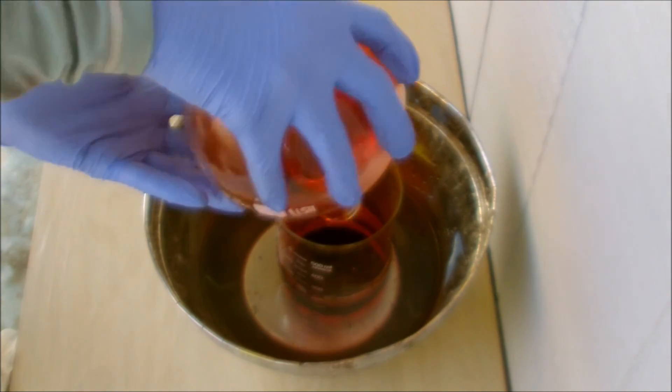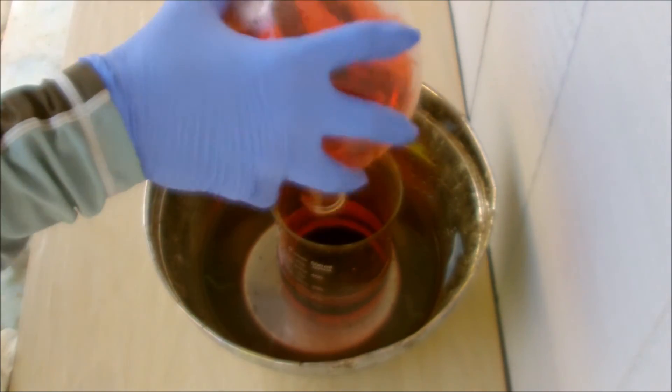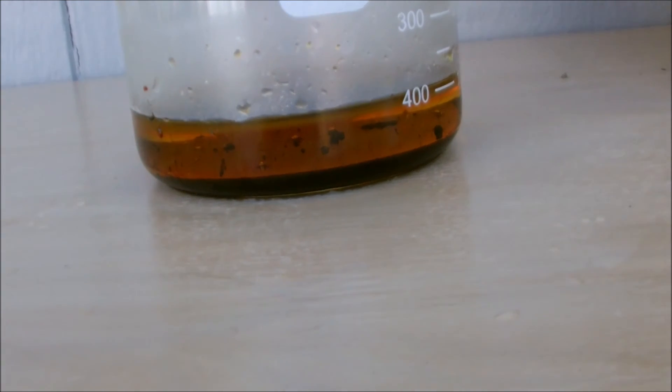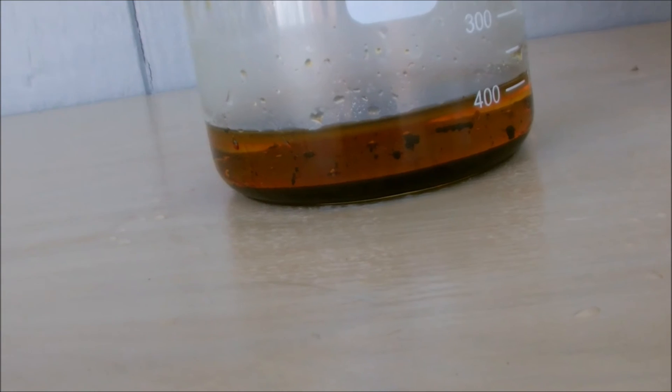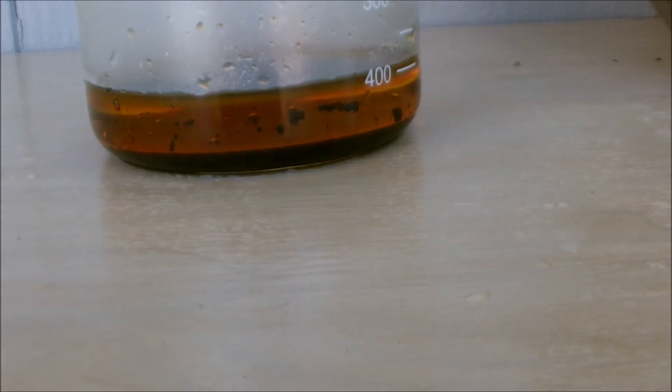Man, that is quite a bit of bromine. As you can see, the bromine is separated from the sulfuric acid, and the water has been absorbed by it as well. Now let's separate it.